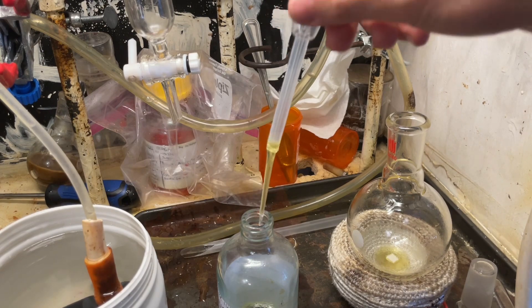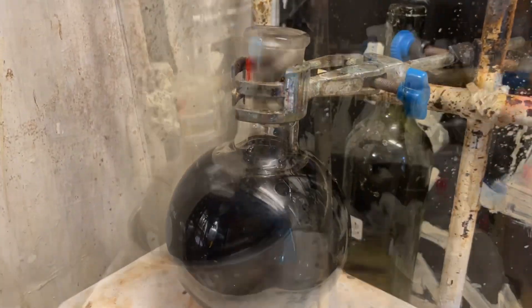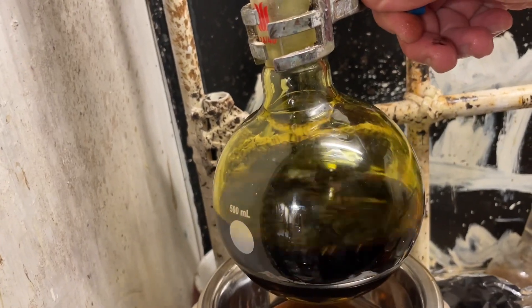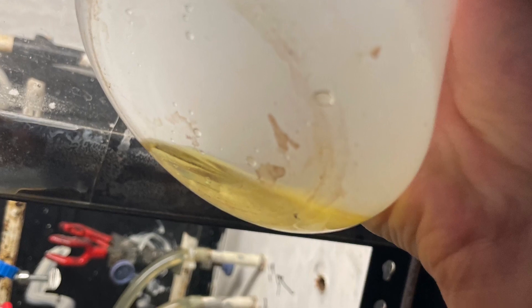Here's our nitrobenzene. We got it into a bottle. And here is our mixture after one hour — I basified it with a bunch of sodium hydroxide and steam-distilled it once again. And now we have this weird color-changing soy sauce. Here's our distillate, which contains our yellow quinoline.